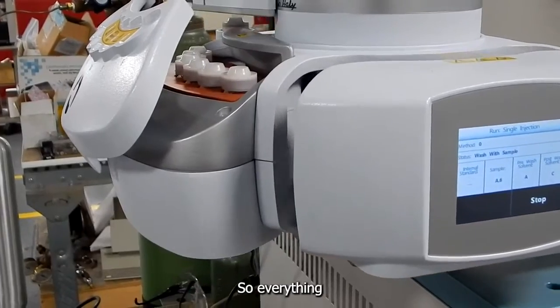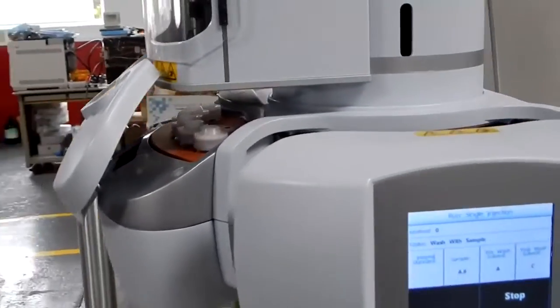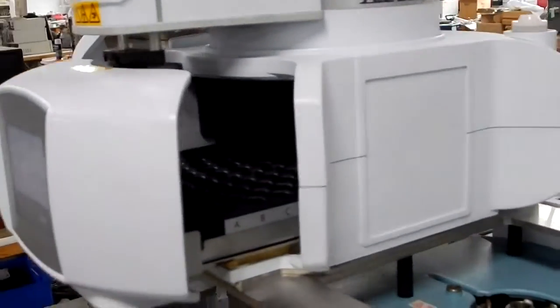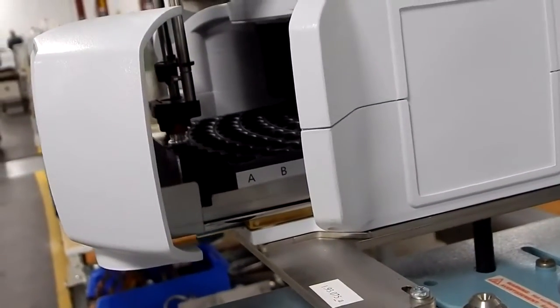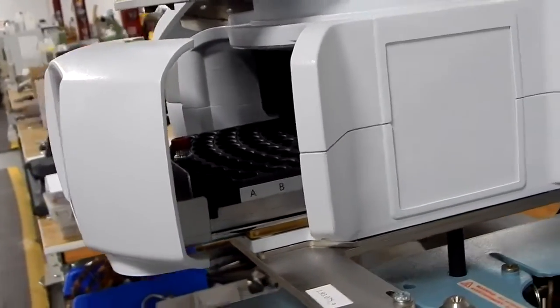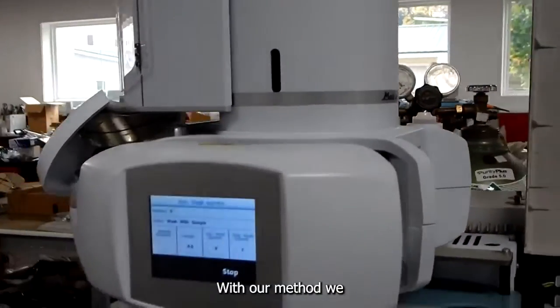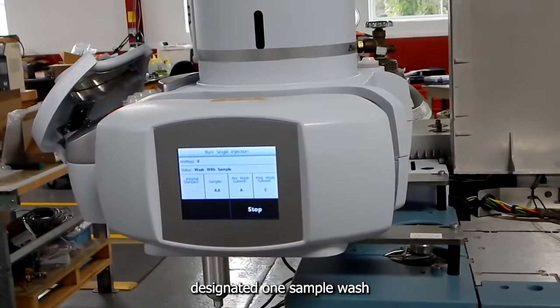So everything generally lines up very well. In our method, we designated one sample wash to waste.